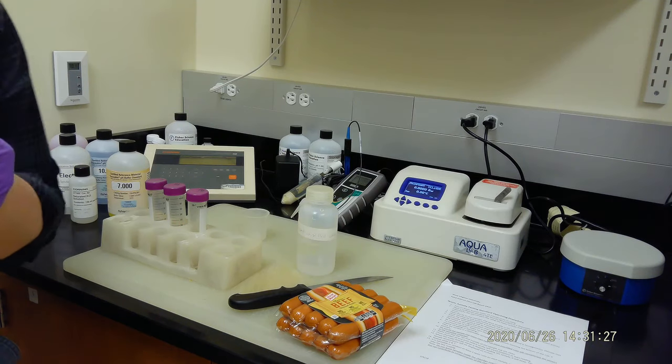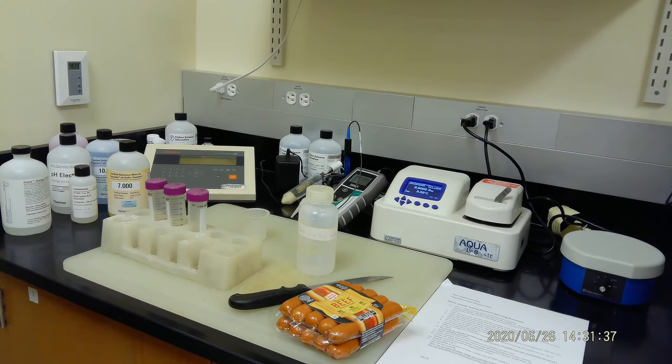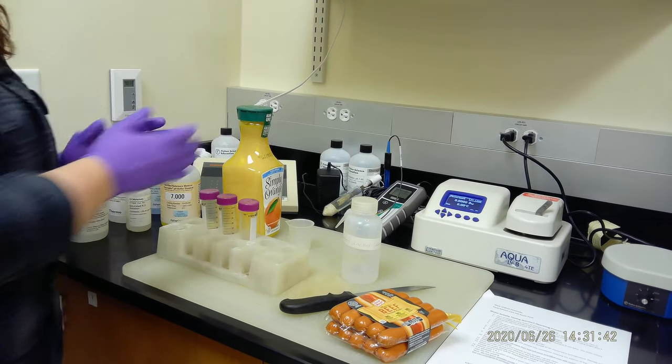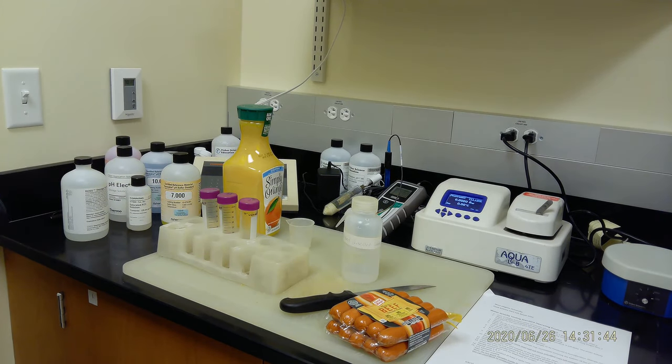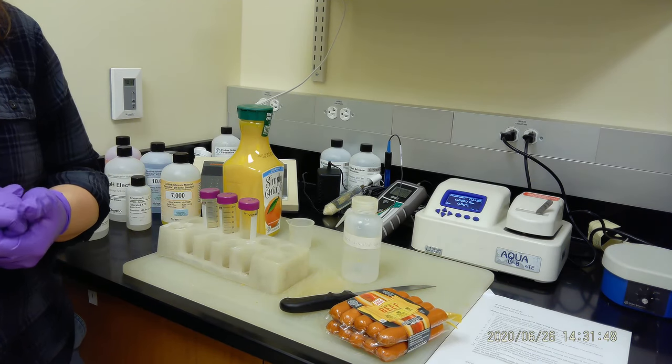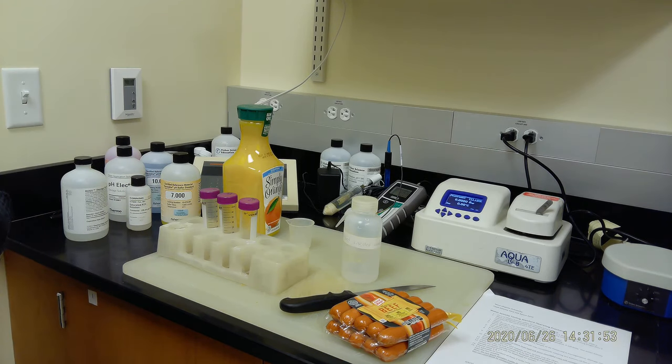Okay, so KC will show us water activity and pH meter, how to use. Those are two very important items for quality, especially if you're working in the industry. That's what you're going to measure every day for water activity and pH. So first let's show them how to do water activity because this takes time, and during the waiting time we can do pH.